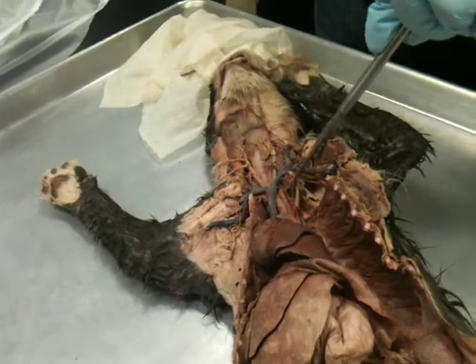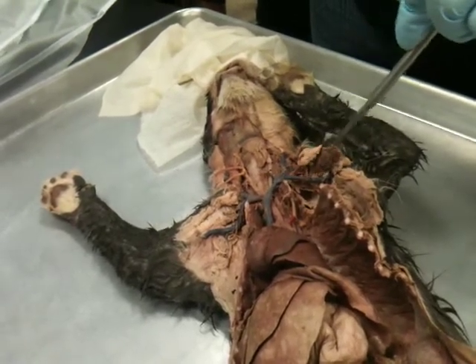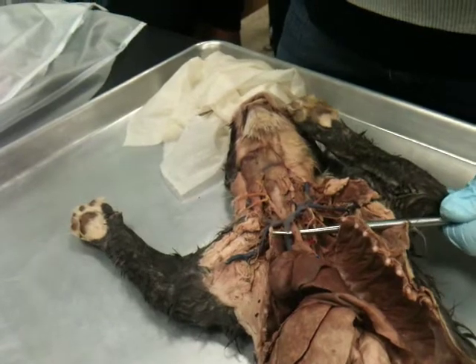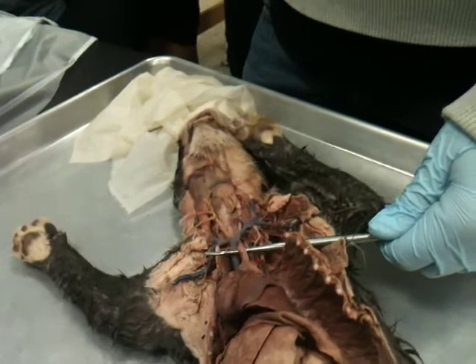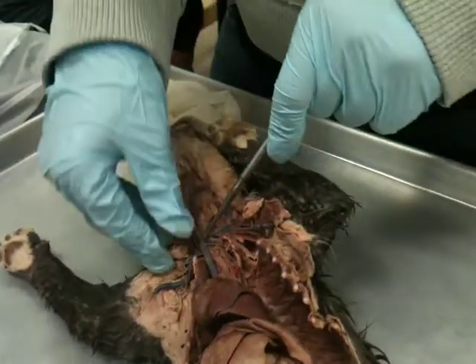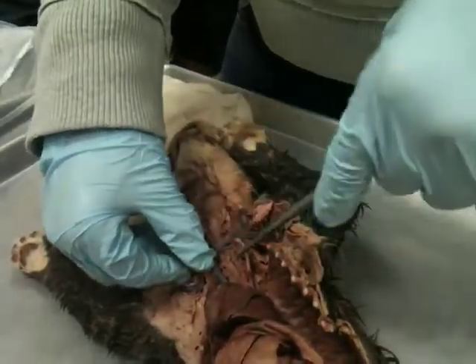That small branch on the left side, if we follow it, goes all the way up and over into the arm. So what do you think that's called? Subclavian. So that's the left subclavian. Then this big branch on the right side off the aorta is called what, do you think? Brachiocephalic. So when we talk about the arteries, there's only one brachiocephalic artery, whereas when we're talking about the veins, there are two brachiocephalic veins. We can follow the brachiocephalic artery up, and here we can see it branches into three branches. Two go up into the neck, and one goes over into the arm.